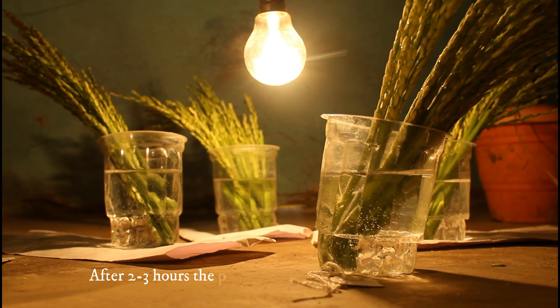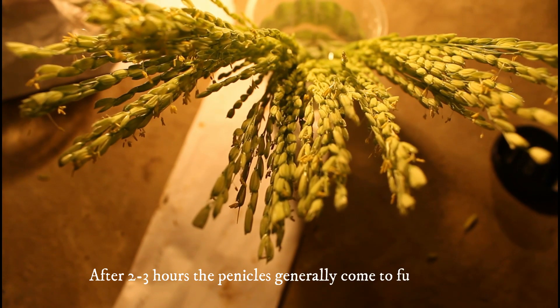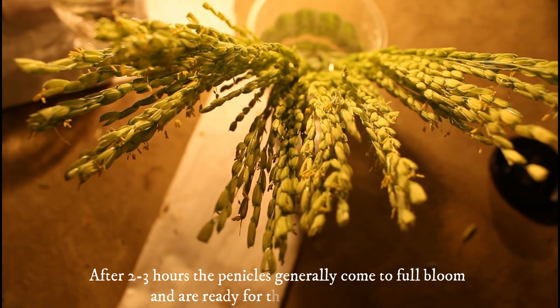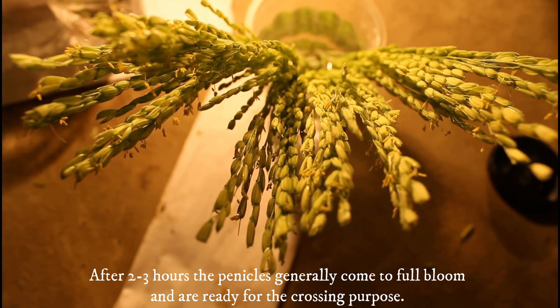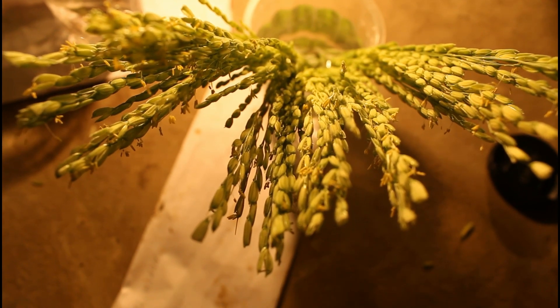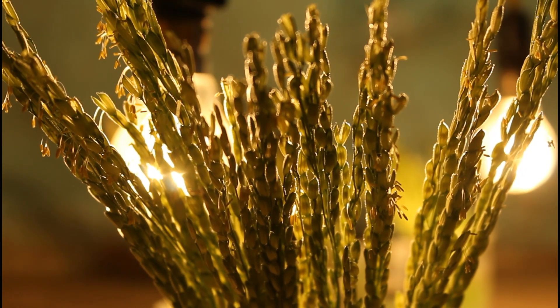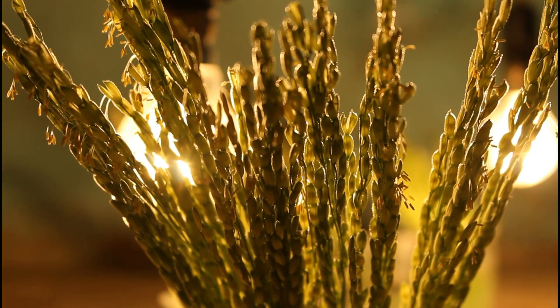This condition helps in uniform anthesis or opening of spikelets. After 2 to 3 hours, the panicles generally come to full bloom and are ready for the crossing purpose.